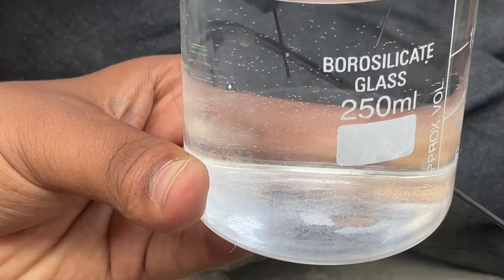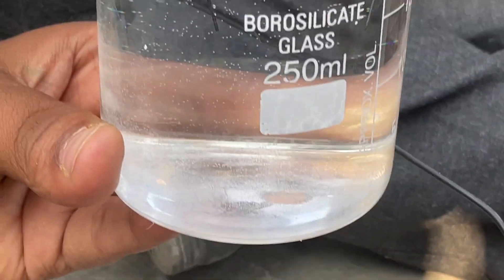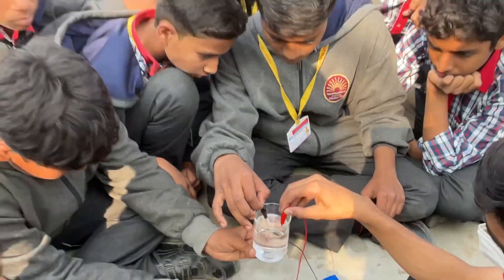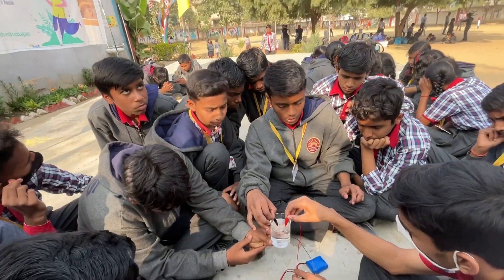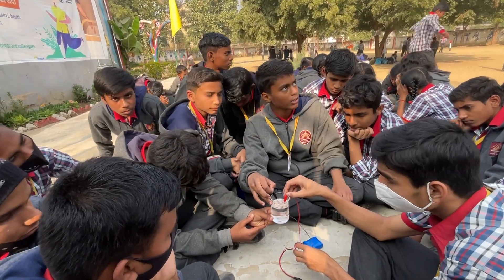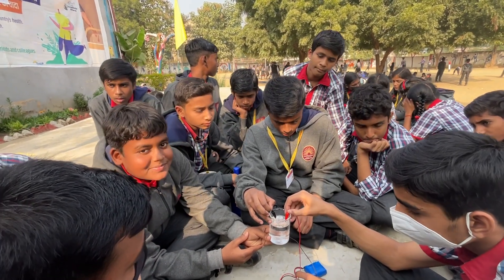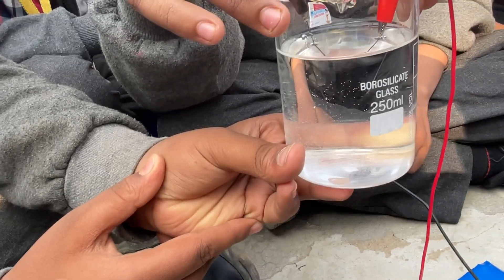In the middle, the blue rod at the bottom — it's not oxygen. How did you tell? The black rod, or negative terminal, produces hydrogen gas. And the positive terminal produces oxygen gas. The amount of bubbles of hydrogen gas is more — just twice that of oxygen gas.